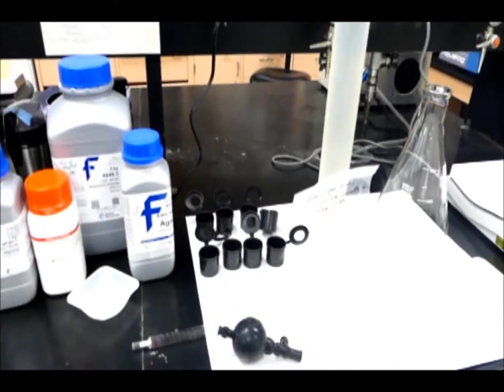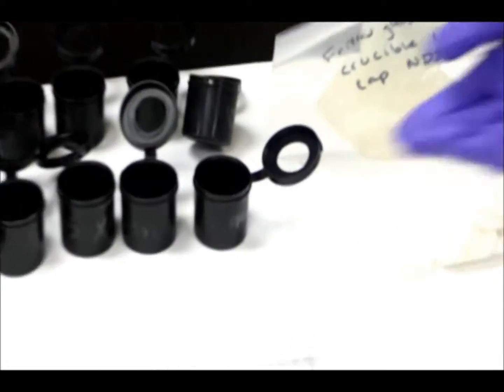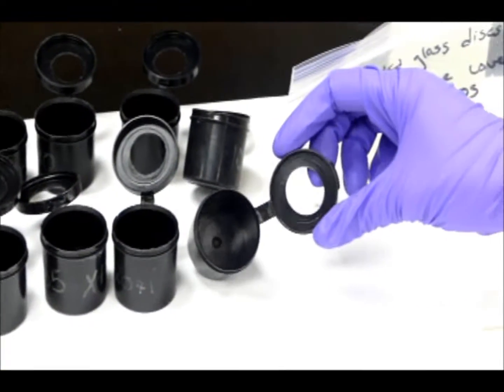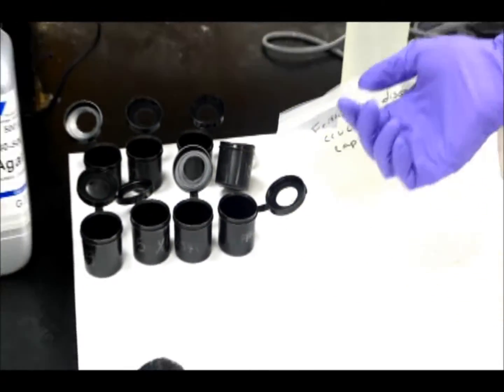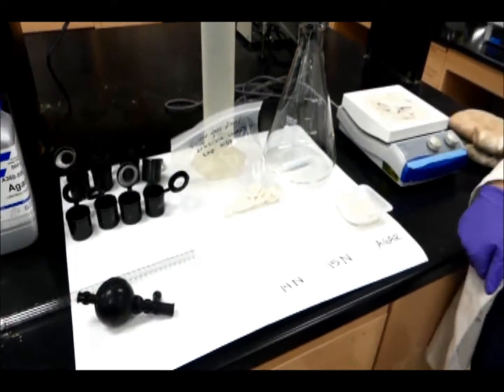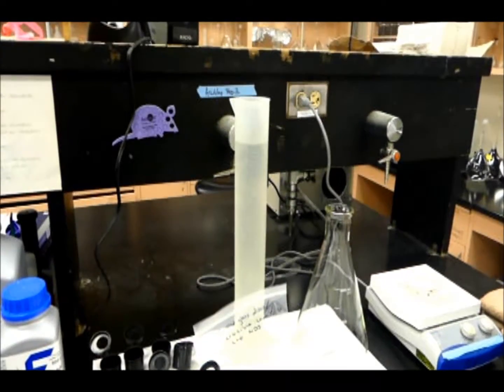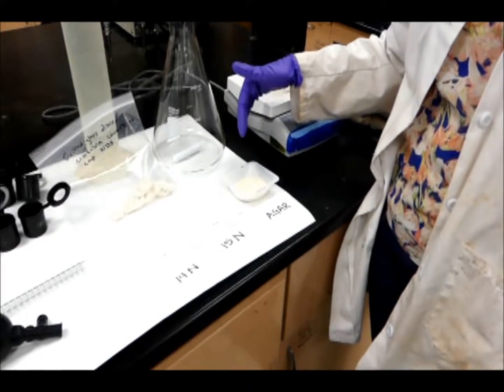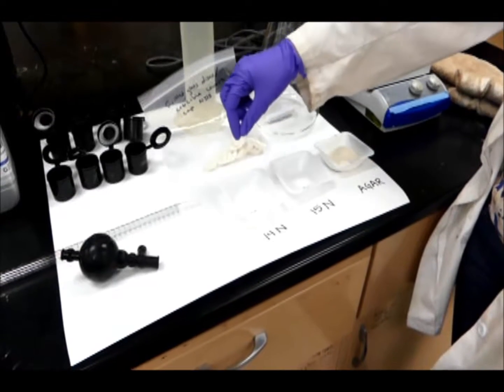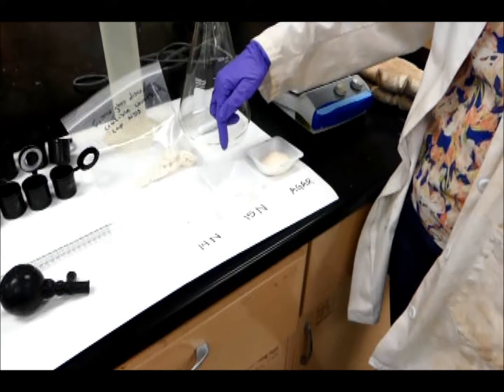I'm going to go over the supplies that we use first, where we use these plastic cups to put the nutrient diffusing substrates in. You can use a film canister as long as it has a hole in the lid to allow the nutrients to diffuse out into the stream. We use fritted glass discs on top so that the bacteria have something to grow on. We'll use a liter of water. So we're going to add 20 grams of agar, and then our nitrogen will be in concentrations of 0.4 molarity for the 14N and 0.1 molarity for the 15N.